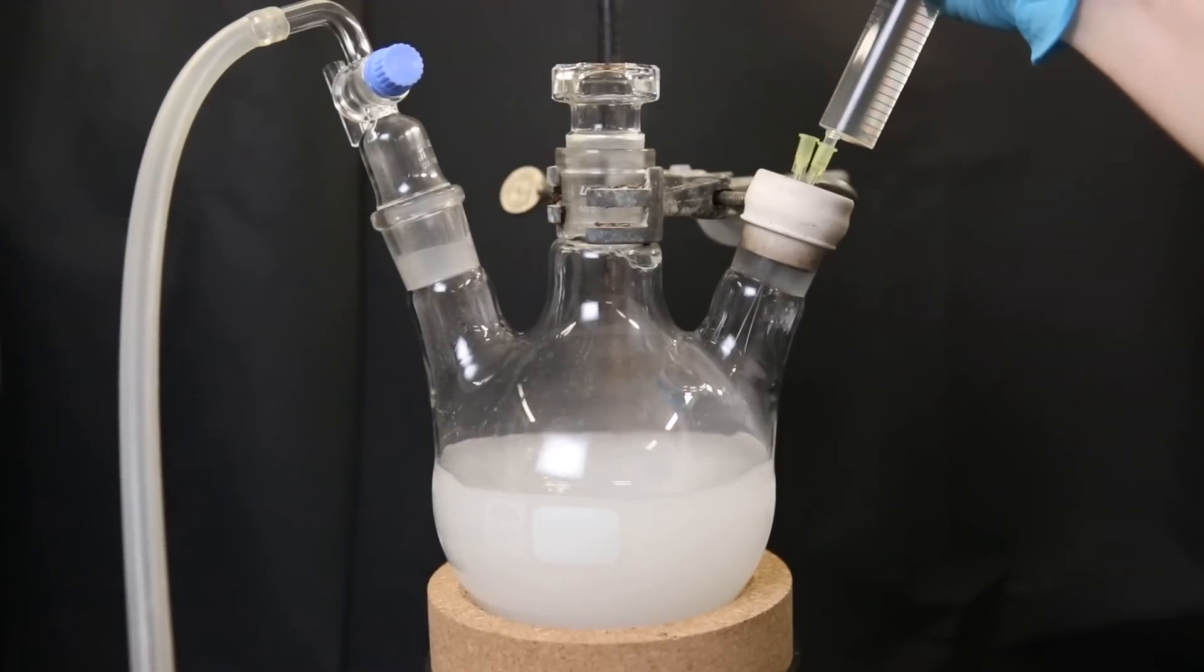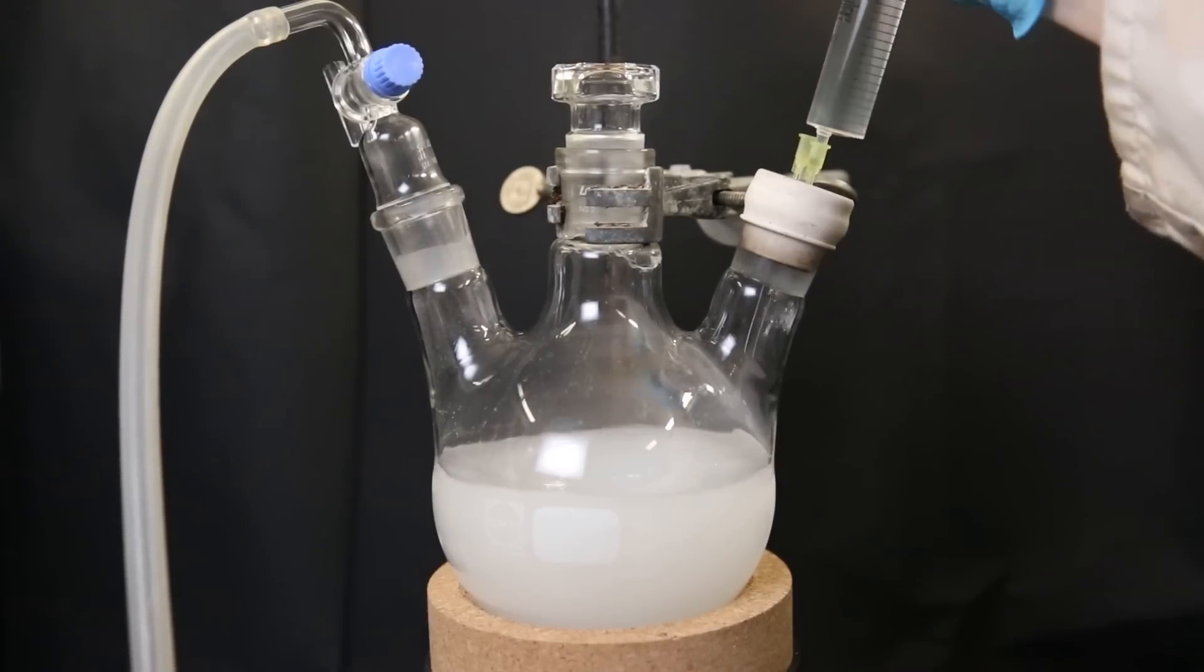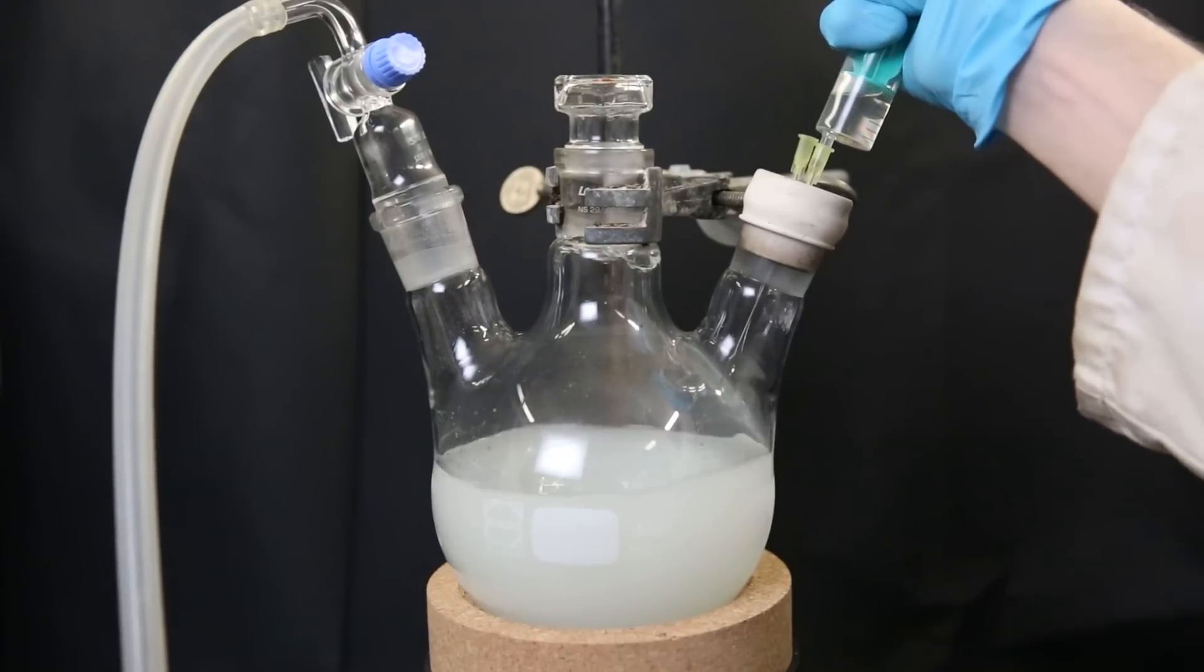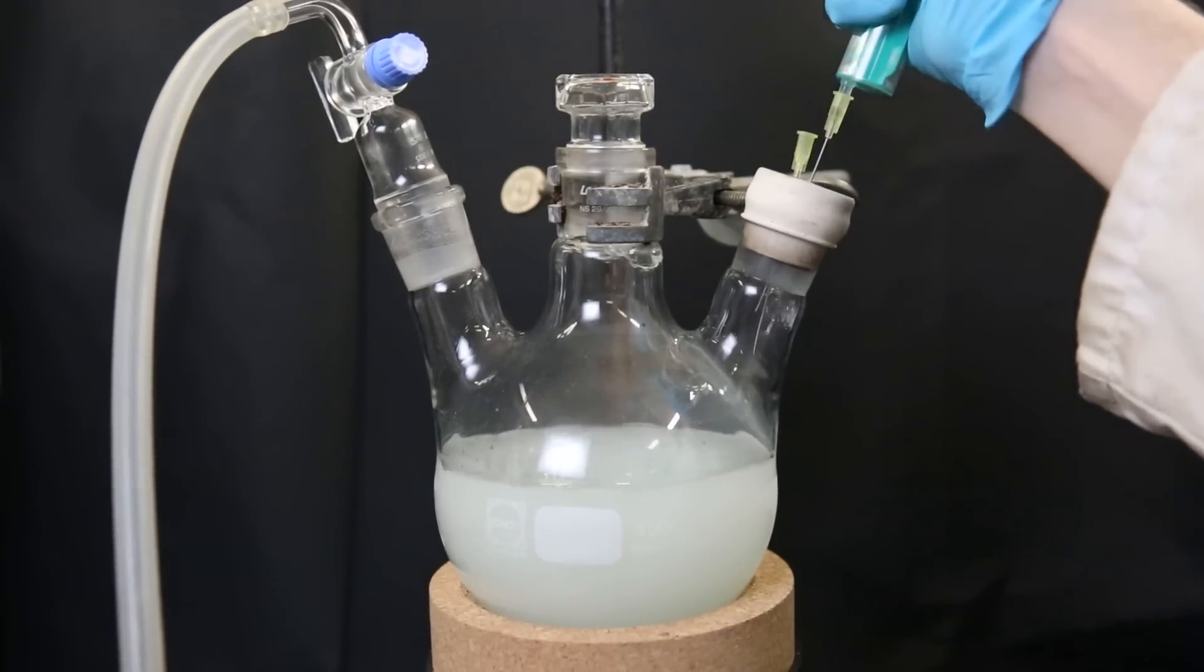As I'm injecting the complex, the solution slowly turns green, and we can also see that there is a little too much argon overpressure, which pops out the stopper and adapter, but it's not really a problem.